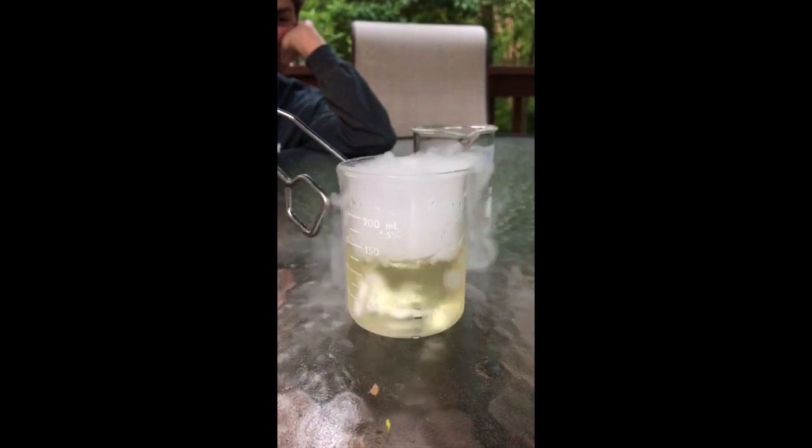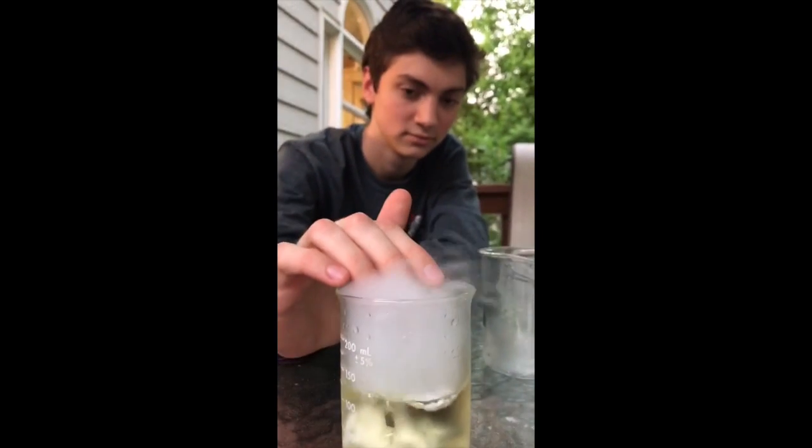As expected, the indicator changed from a blue color to a yellow color, seen here. As we will learn later, the K value of this reaction is incredibly small. This means that the reactants are favored. As we can see here, the water level remains relatively constant, and there is way more water than carbonic acid formed.